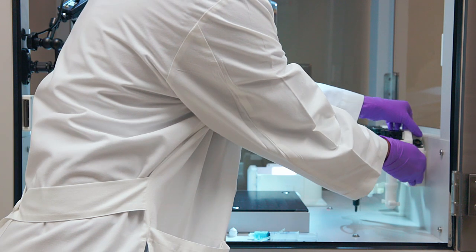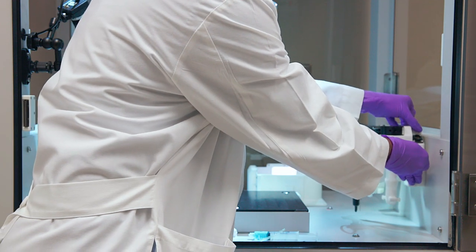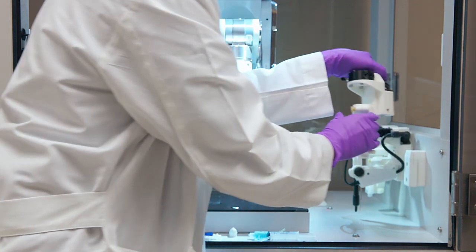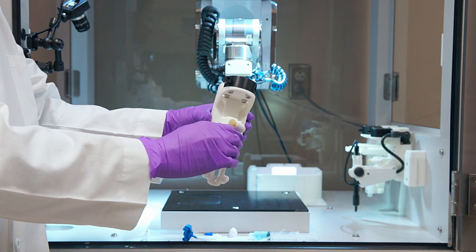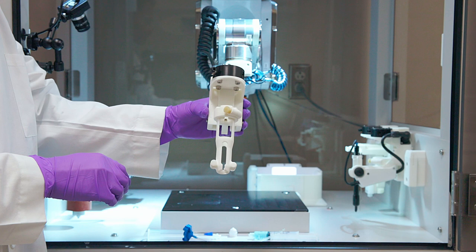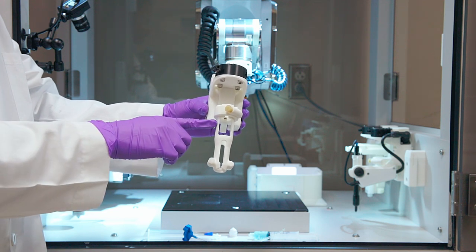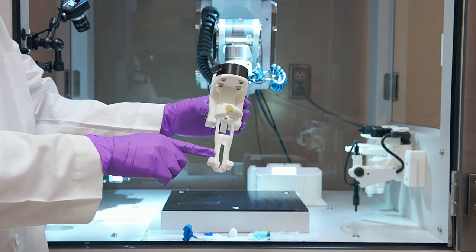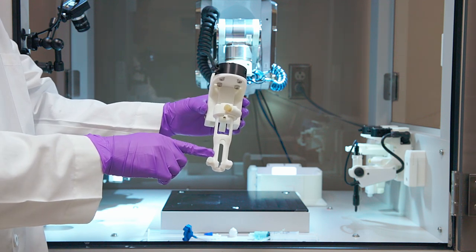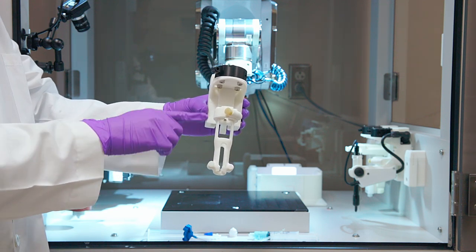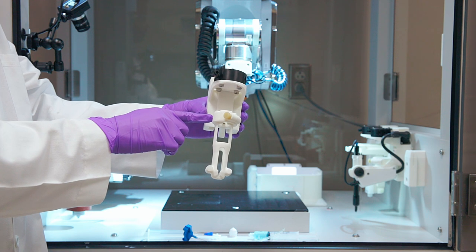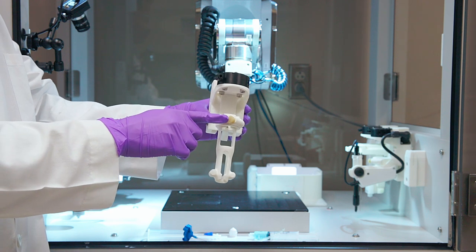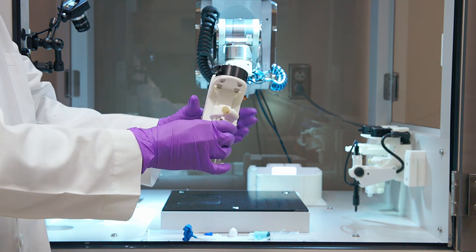Today, we will be using single syringe printhead. This printhead uses 30 cc syringe. With the help of an adapter, we can use 10 cc or 5 cc syringe. Unscrew the screw to load the syringe.